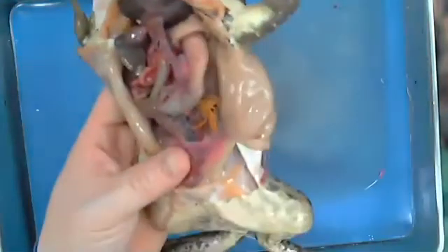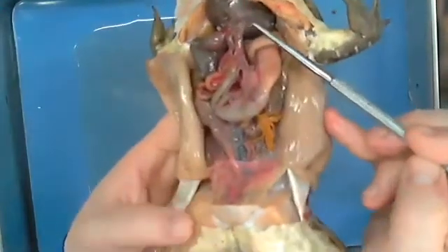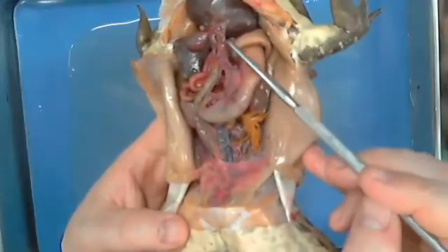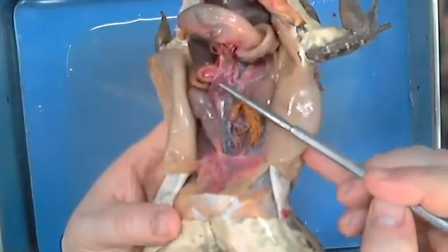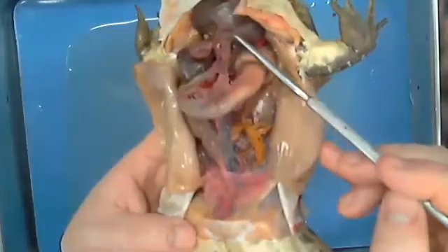So again, you can kind of see that. Wait, you just said the spleen was that little ball thing down there. This is pancreas. Sorry. The spleen is this ball that's right here. You can see it right here. Cool. Okay? All right, so there is our pancreas.